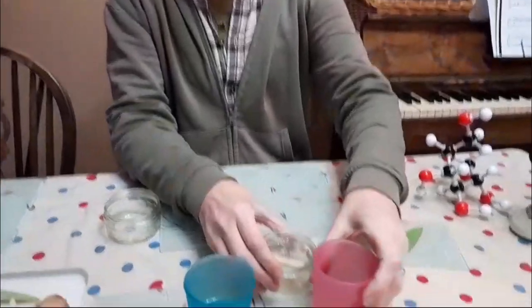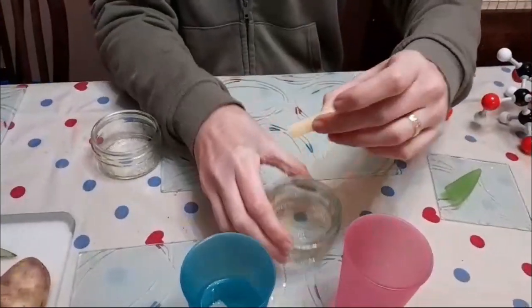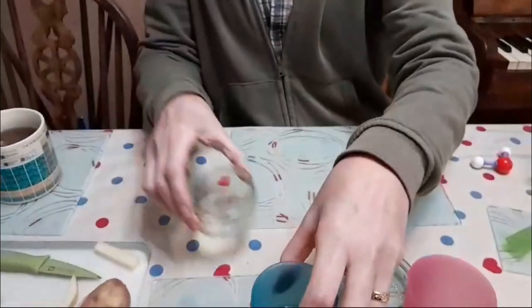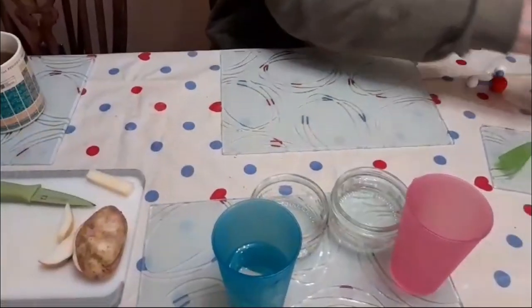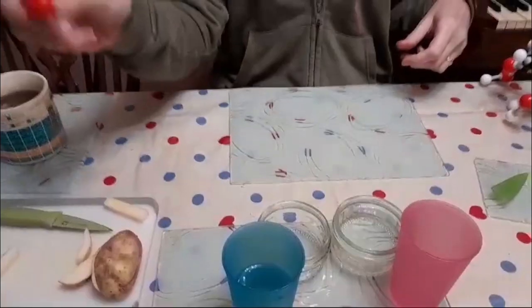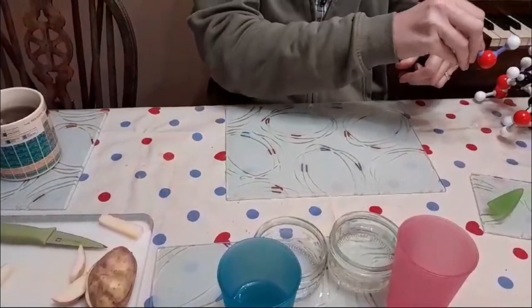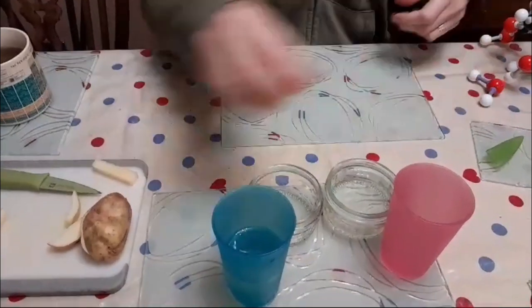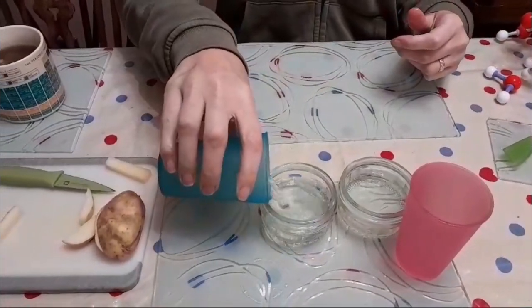And if the water moves out of the potato, normally we measure the mass of the potato and we see that it's lost mass, it's lost water. So let's see what's happened. There we go. So I've got a potato here. All right. Let's compare that to the hypotonic. Again, the sugar can't move out of the potato into the water, so the water is going to move from the water into the potato. It's moved from an area of high water potential to an area of low water potential. Let's just see if that's worked.